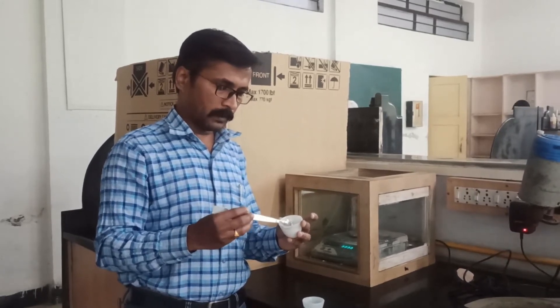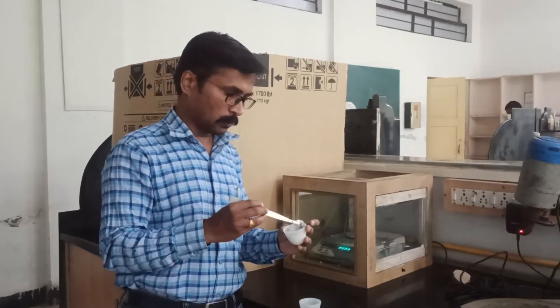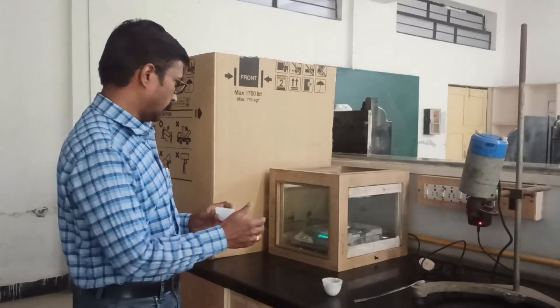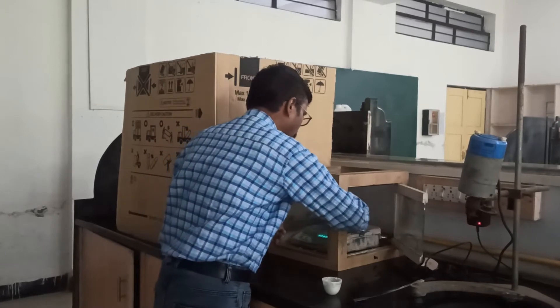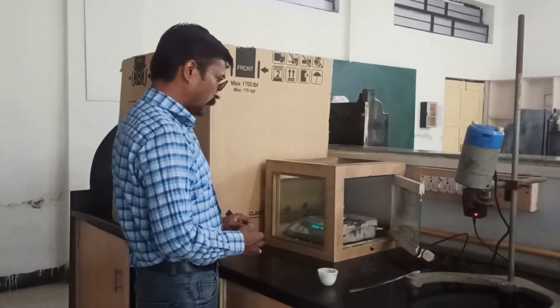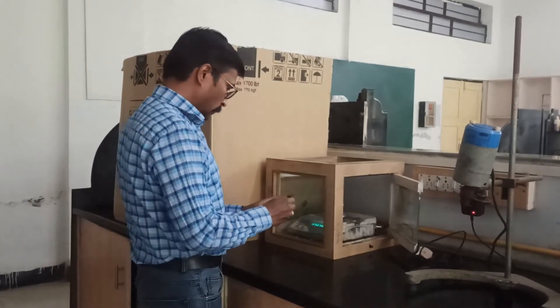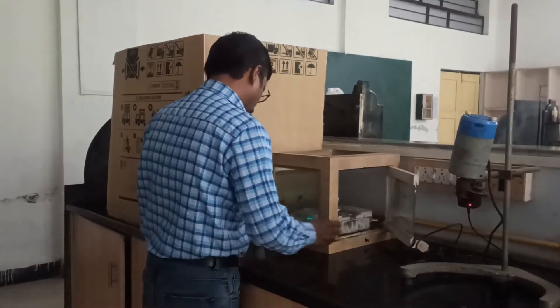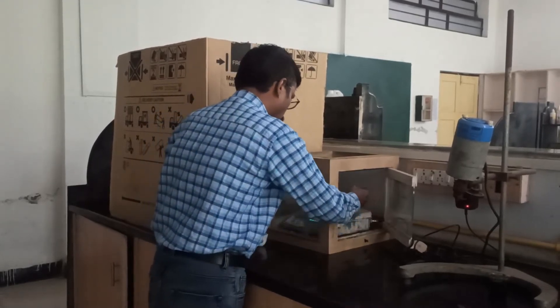The difference between the initial weight and the final weight of the soap sample will indicate the percentage moisture content. For this experiment, first we will measure the weight of the empty crucible. The weight of the empty crucible is 27.879 grams. Now we will measure accurately 5 grams of soap sample in a crucible.